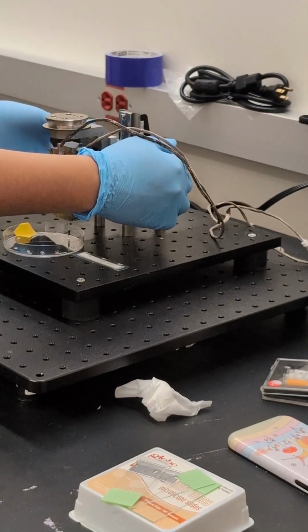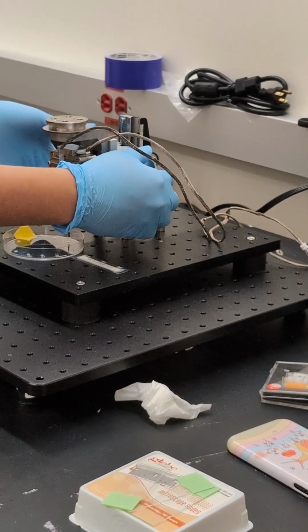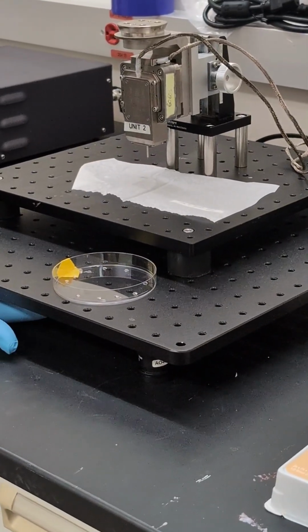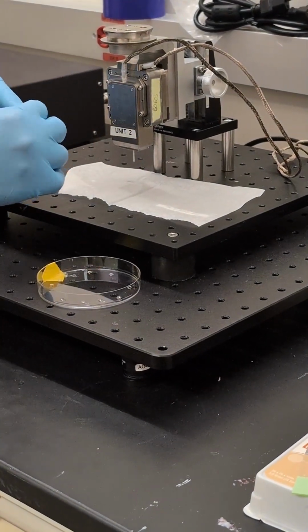So you've got to hold it. You kind of have to hold it a little bit. Move it a little more. So you kind of have to reach down, try to get it. Again, my hand, compared to this, is too big.